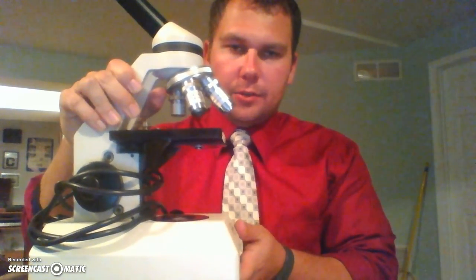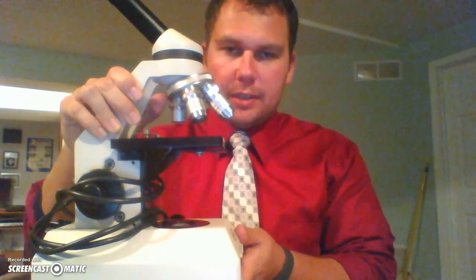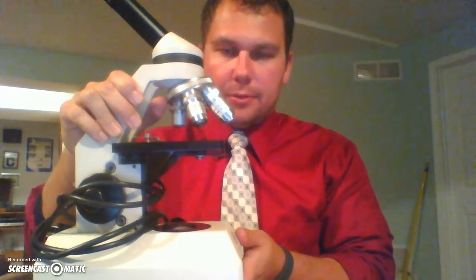This tool used by many scientists through the biological community is called the microscope, sometimes called a compound light microscope. What was covering the microscope is called the microscope cover. Please be sure you do not lose these or tear them or anything bad. Sometimes it is helpful just to place it in the sink next to your workstation.